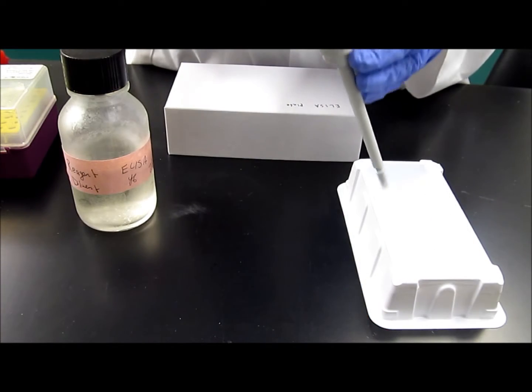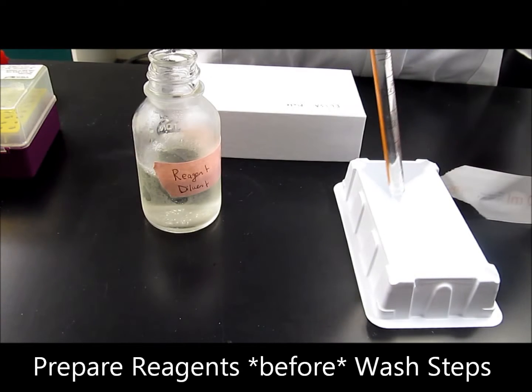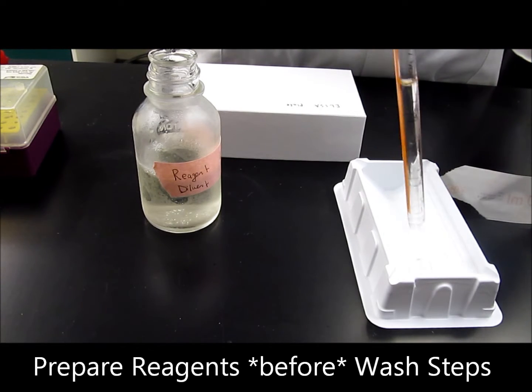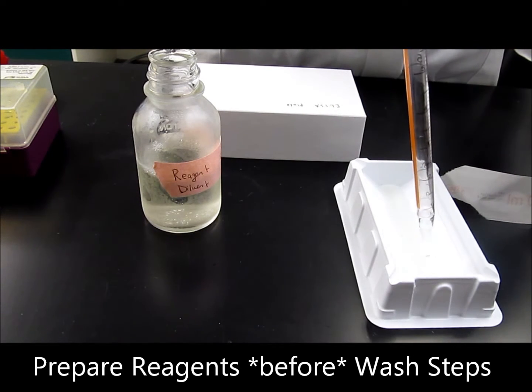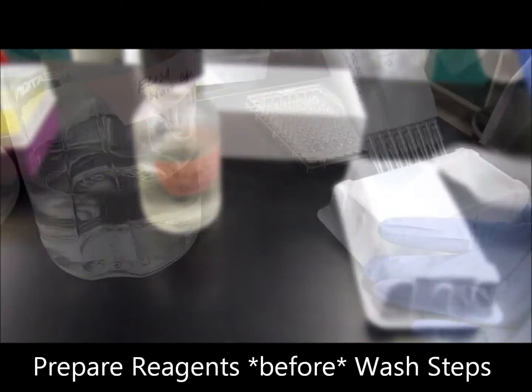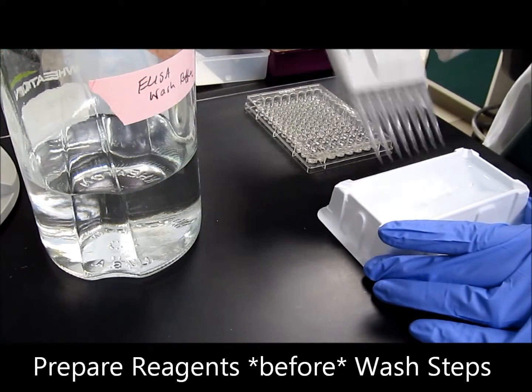As a side note, it is important to prepare your reagents before doing the washes instead of the other way around. This will help prevent the ELISA plate from drying out between steps, which could be harmful to the samples.